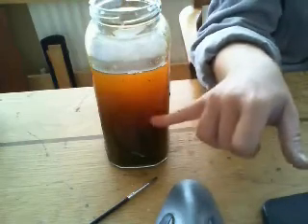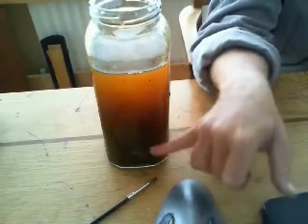So I centrifuged that solution and washed it in a weak solution of hydrochloric acid, centrifuged it again, washed it again, then washed it in deionised water until I got a precipitate out. That precipitate was a kind of silvery-brown, because of unreacted graphite and the graphene oxide we were looking for. So then I put it back and added some deionised water, and you can see the result. This golden-brown stuff is what we're looking for — that should be graphene oxide in solution, and it certainly looks right. I'm just leaving it to settle, because you can see it goes to this deeper black colour here — those are larger particles just precipitating out, and in there will be some unreacted graphite.